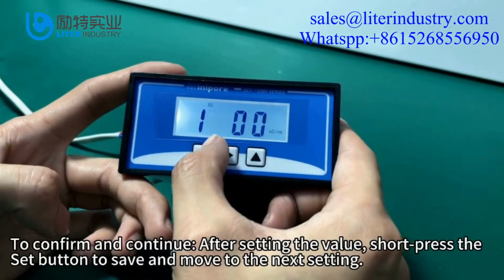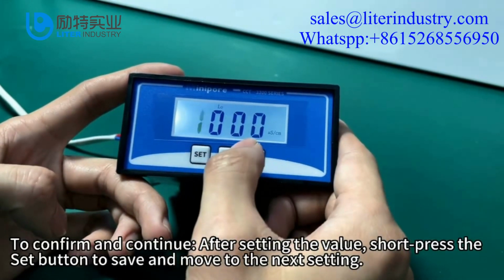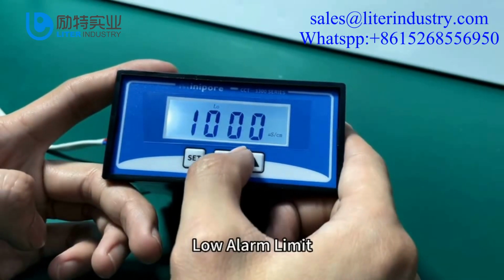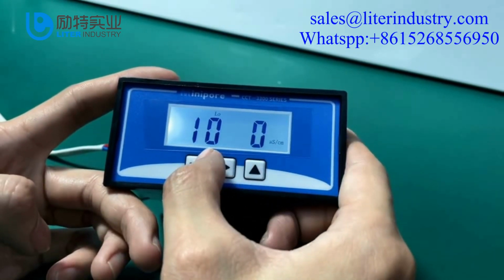To confirm and continue, after setting the value, short press the set button to save and move to the next setting. The settings are completed in this order: high alarm limit, low alarm limit, 4 mA output calibration, 20 mA output calibration.